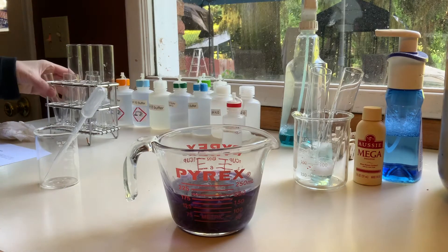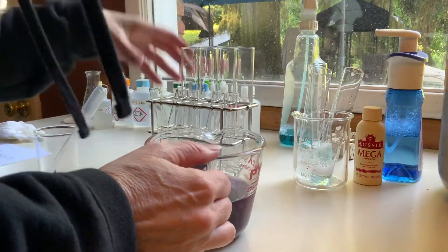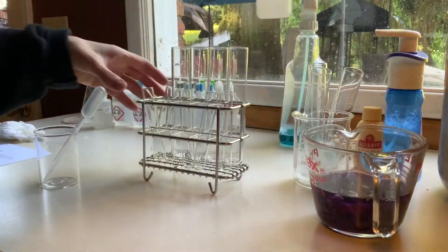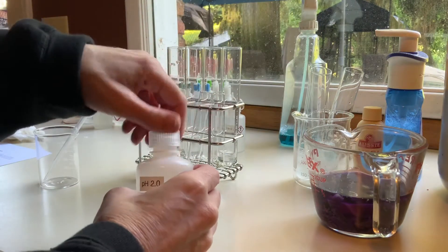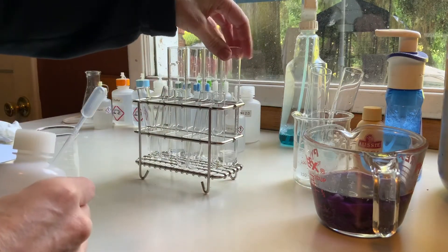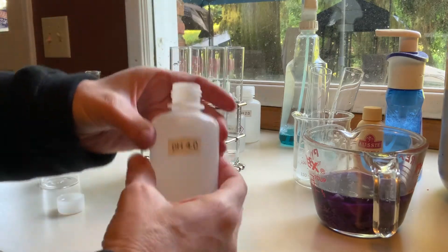In the first part I'm going to fill my various tubes with buffer. I'm going to start on this end with a pH 2 buffer — I'm just going to pour a little bit in. I have these different sized tubes which is not ideal; these are test tubes and these are qual tubes. This is the pH 4 buffer.